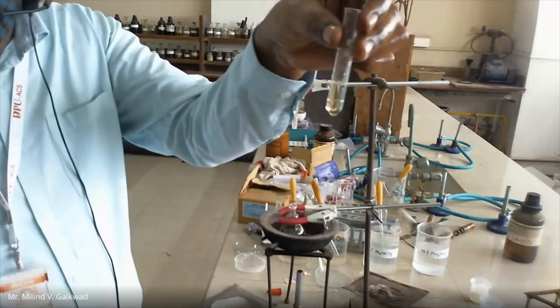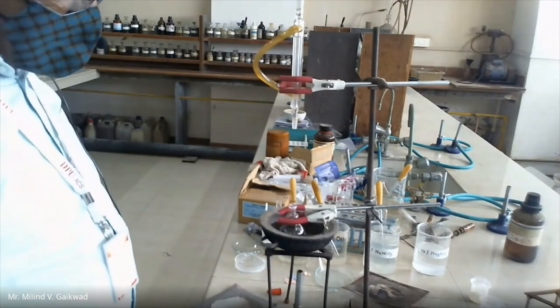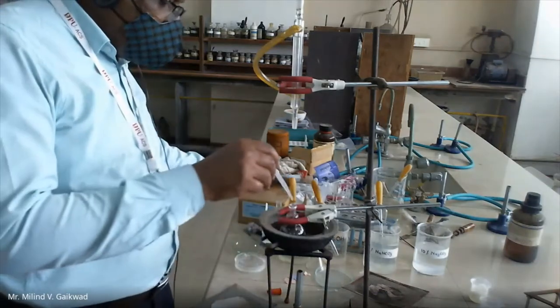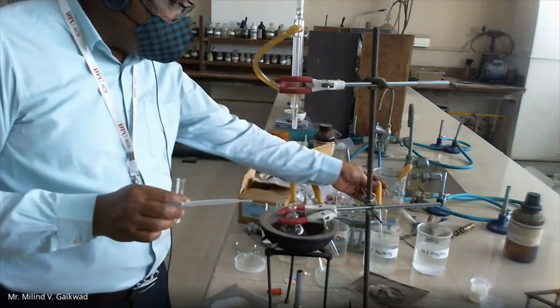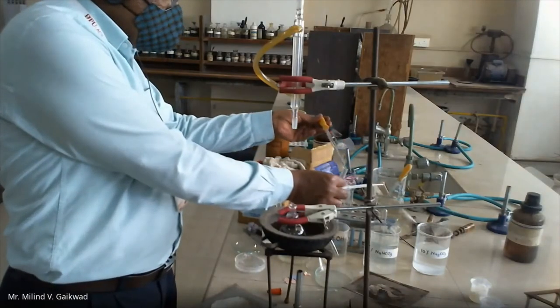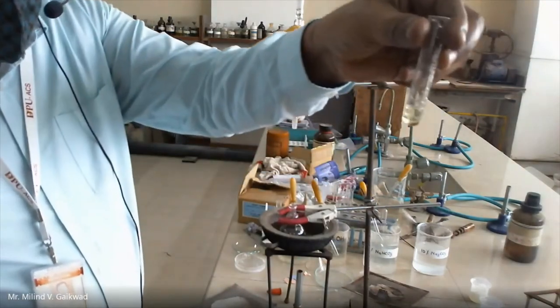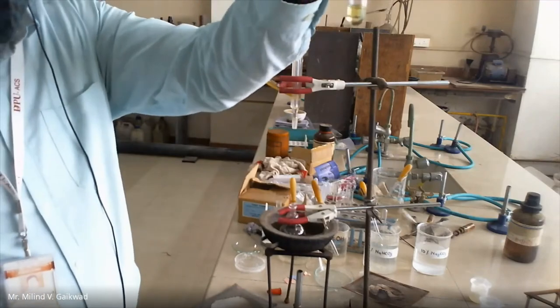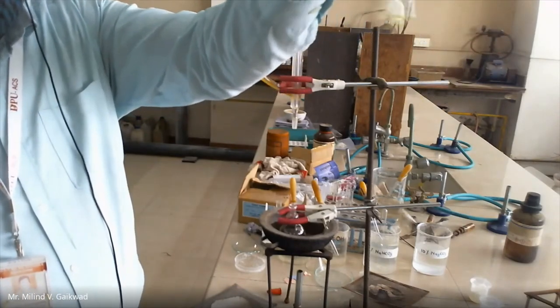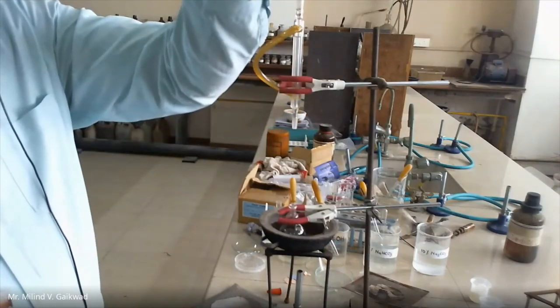Similarly, you can take another compound into the tube and check whether it is water-soluble or not. Here is your first liquid and your second liquid, and I will add water. You see that you are getting two layers — that means it is water-immiscible. You have to check whether it is acid or base using the chemical test. I will take this tube and add sodium bicarbonate. You have to check whether you have any effervescence or not. Here you are having only two layers — it is immiscible. You may say that acid is absent; otherwise you should get only one layer.